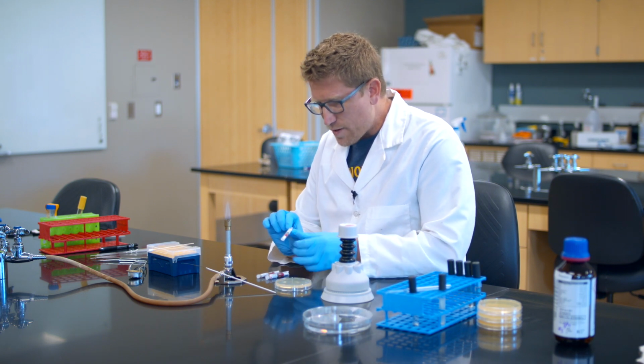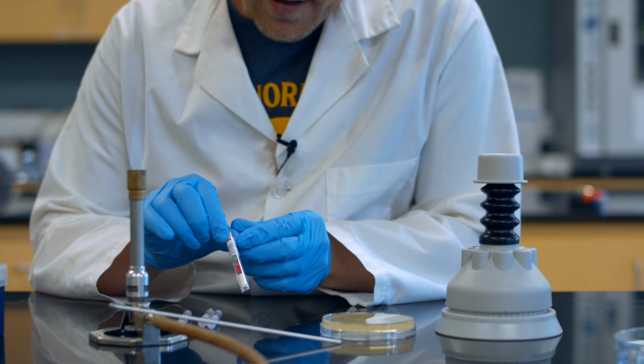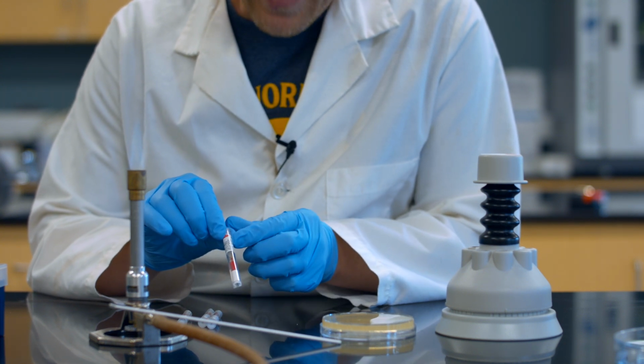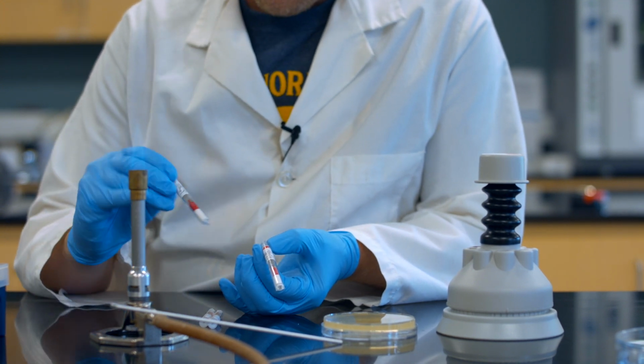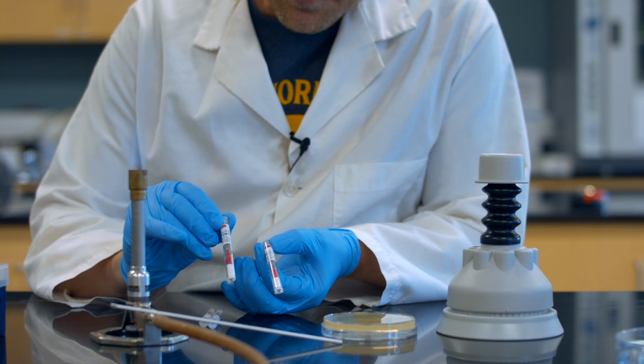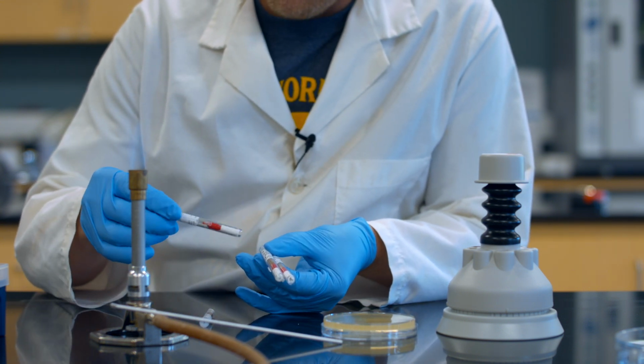So what antibiotics do I have? Well, in this first one I have ampicillin, and you can see it labeled directly across the surface of the label on the top here. So I have ampicillin we're going to challenge our E. coli with. I have gentamicin, and I did grab these randomly, to be perfectly honest with you.